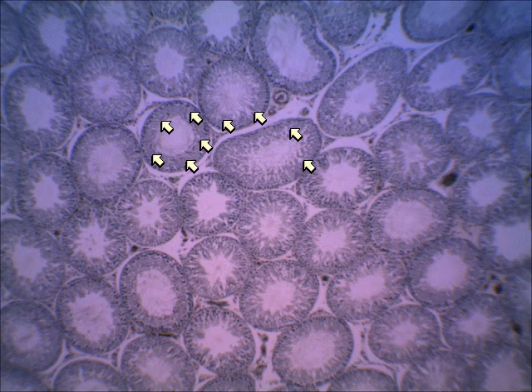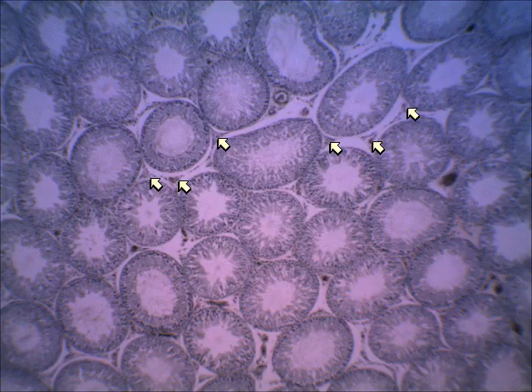So that process of sperm cell production that's in the seminiferous tubules is called spermatogenesis. So the sperm would be one of the products produced by this organ, the testis. The other product would be hormones. And the hormones are produced by cells in between the seminiferous tubules. And I'm pointing to these areas in between the seminiferous tubules. The cells there produce hormones like testosterone.